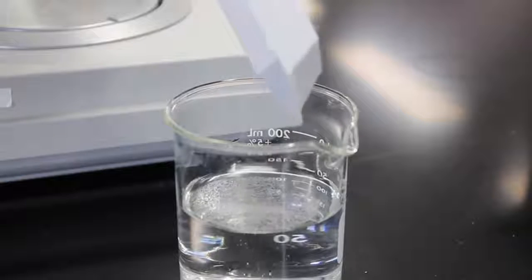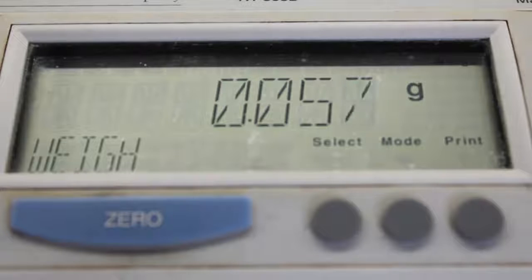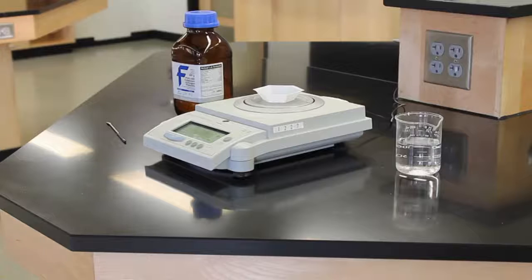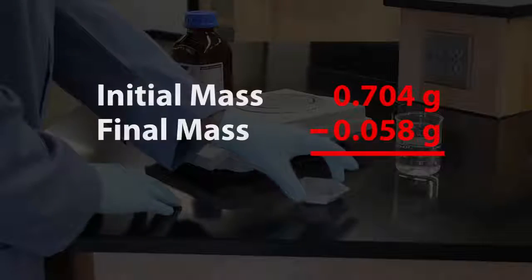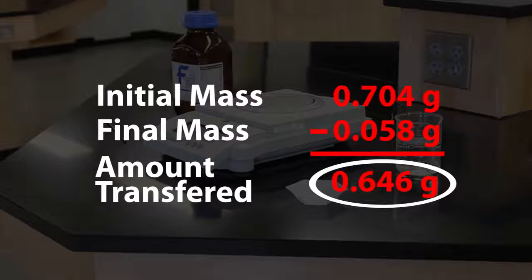Now place your transfer container back onto the balance. Because not all the material will come out of the container, the mass is a bit more than just the container itself. Record the final mass. Now take your initial mass and subtract your final mass. This will give you the exact mass of material that was transferred.